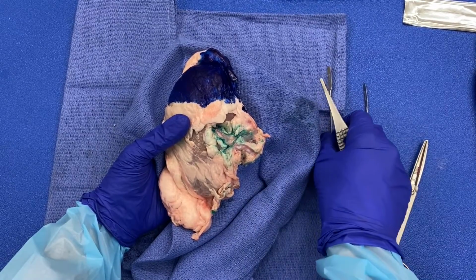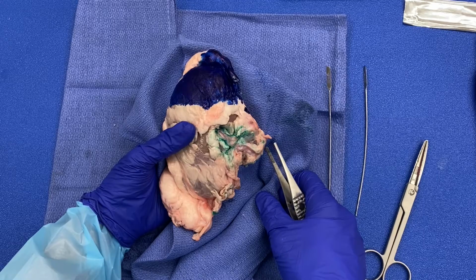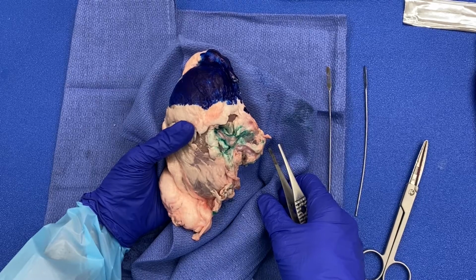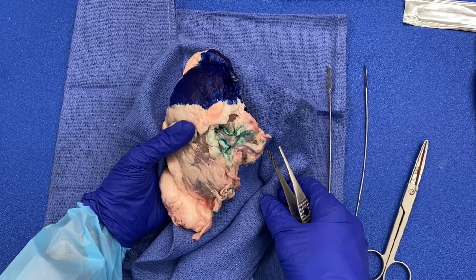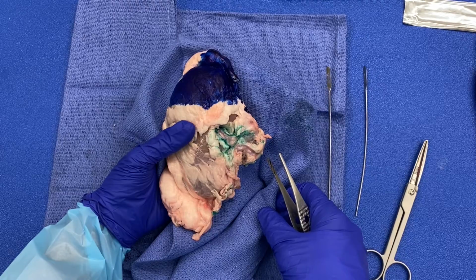Prior to beginning a kidney prosection, it is imperative that you review the patient's imaging and clinical history to determine if renal vein involvement of tumor was identified. You will need to look in the renal vein to determine if tumor is present and make sure that you document it with your gross description and with a section submission.